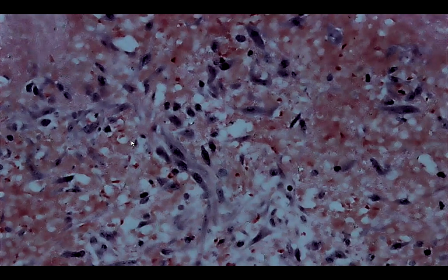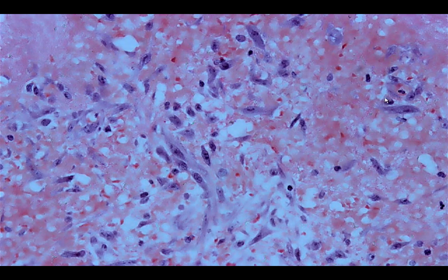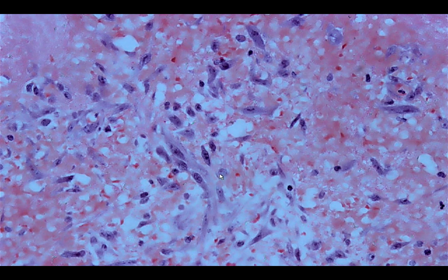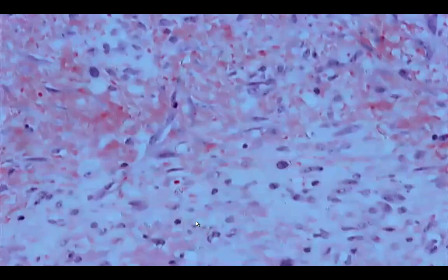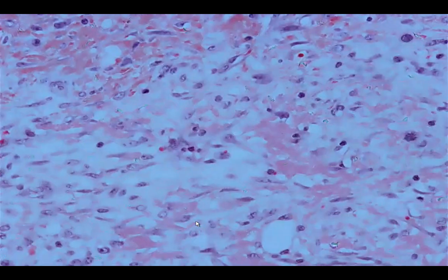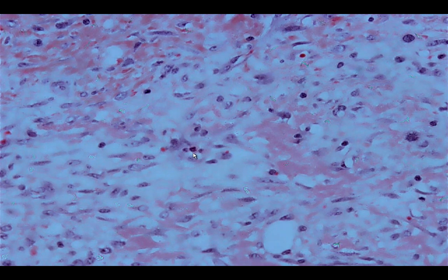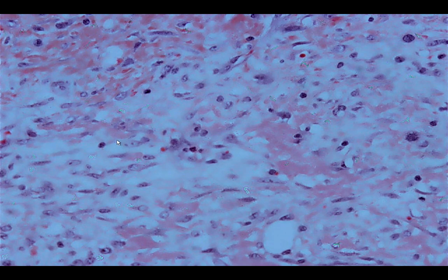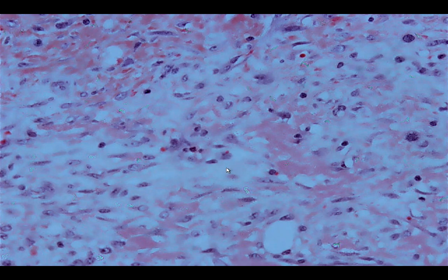What we have here is the presence of fibrin and some red blood cells. Looking at higher magnification, we have a mixture of cells. We have segmenters, fibroblasts, lymphocytes, and histiocytes. Segmenters would be the predominating cell during an acute inflammatory process. Lymphocytes and histiocytes are the most common inflammatory cells in a chronic inflammatory process.